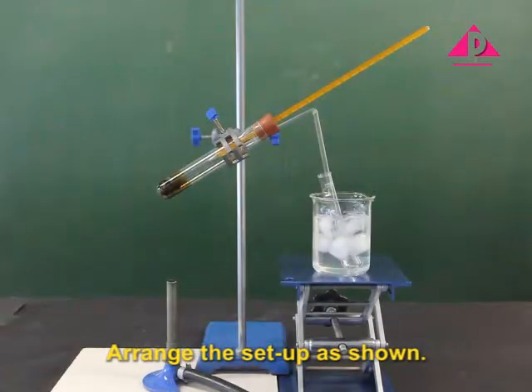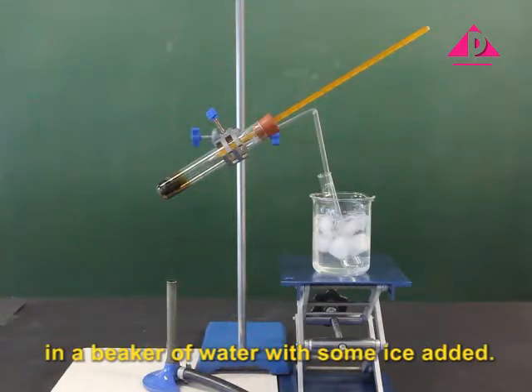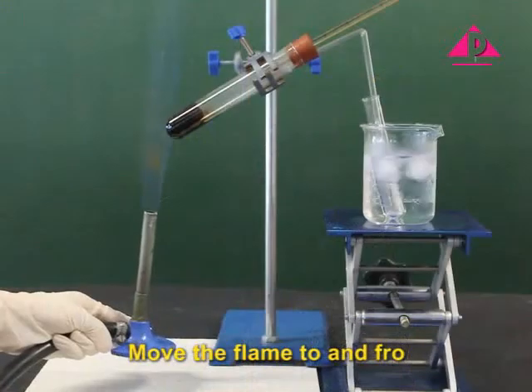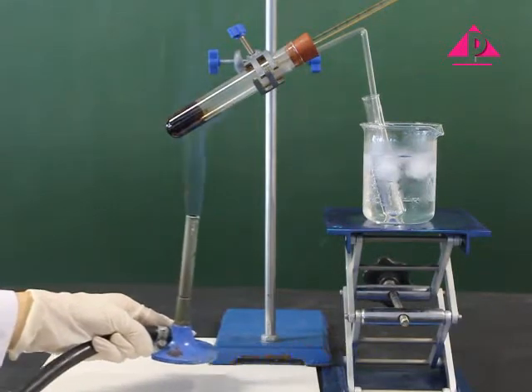Arrange the setup as shown. Place a test tube, receiver tube, in a beaker of water with some ice added. Then, heat the boiling tube gently with a small Bunsen flame. Move the flame to and fro to give a uniform heating.